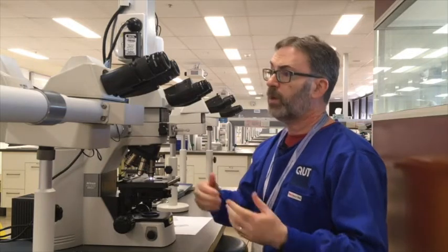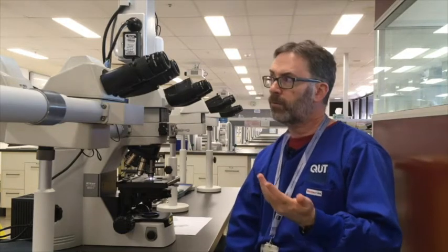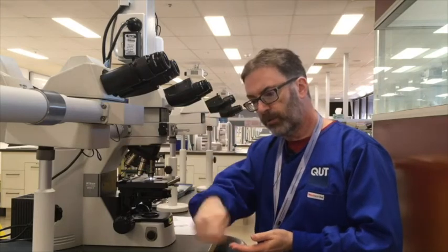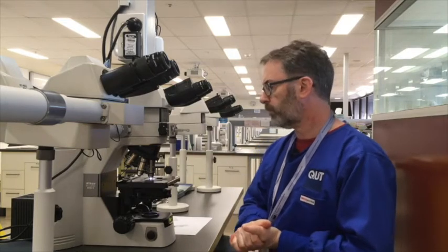And so really the best way to ensure that you're never over-differentiating is to keep your differentiation step down to a level that's brief and manageable. So for myself, with Ehrlich's H&E, 1, 2, 3 dips, straight to the water bath to rinse, blue in ammonia, and you should be okay for most slides.